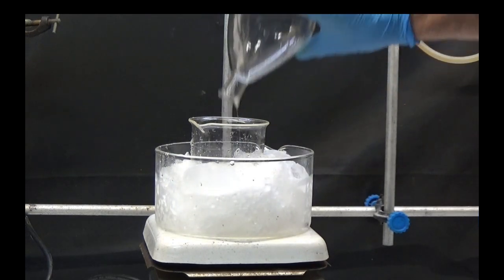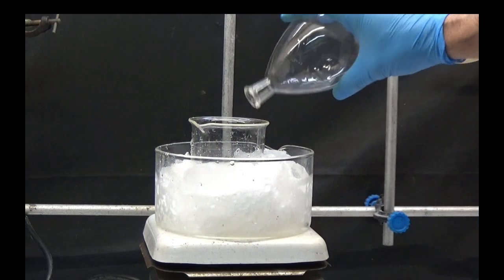Cool in a bath of ice and make alkaline with 20% sodium hydroxide.